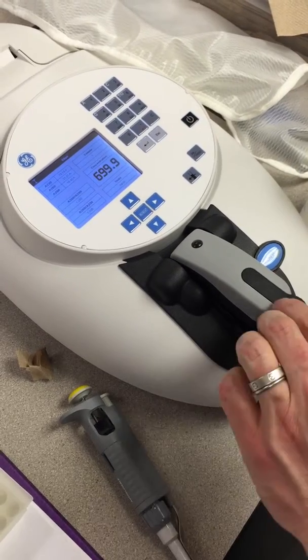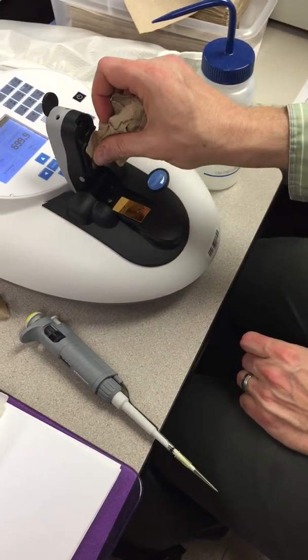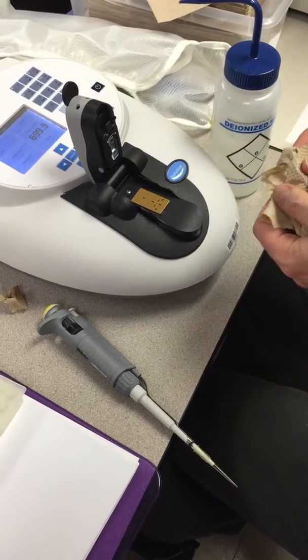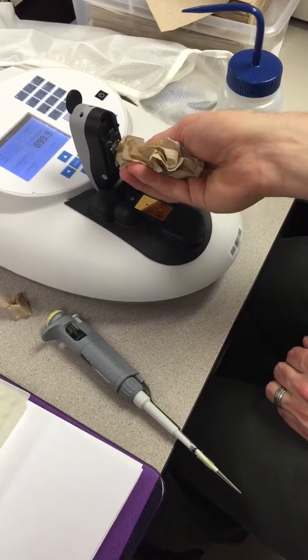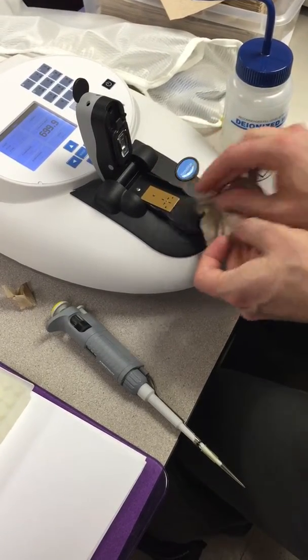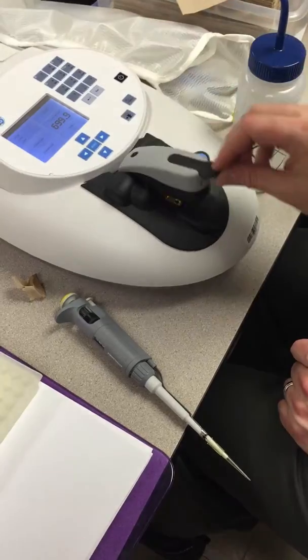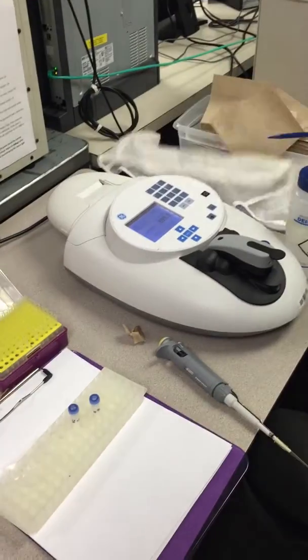Thanks for listening. When you're done, what we'll do is that we'll remove this by just wiping off the material there, using a damp cloth, or sorry, the damp paper towel here, and making sure that there's no residue left behind, and then treating that with a little bit of dry part of the towel here. And that makes sure that we don't end up getting any kind of stuff left behind. And then what you can do is close it, you'll turn it off, and then you'll go ahead and cover the machine up. Thanks.